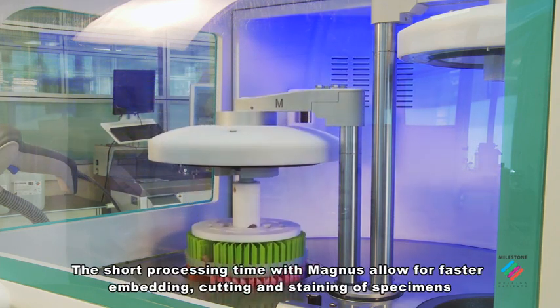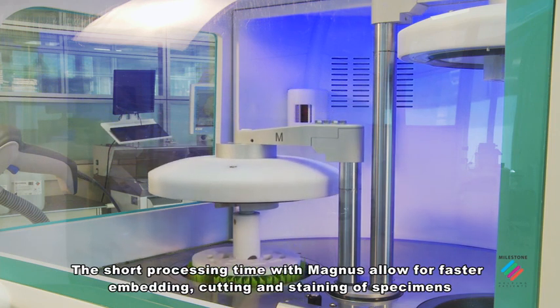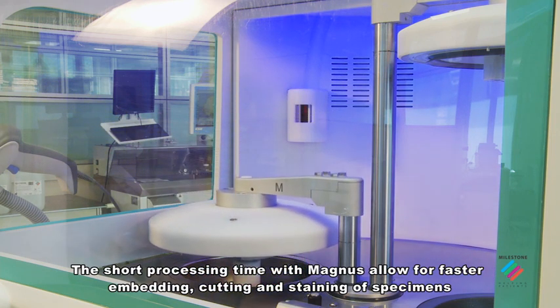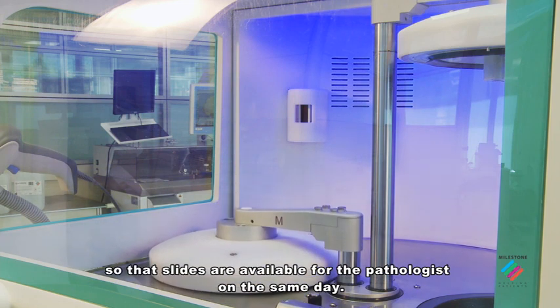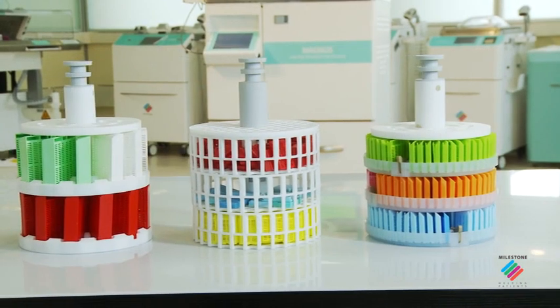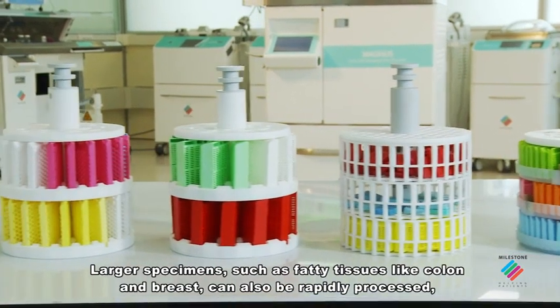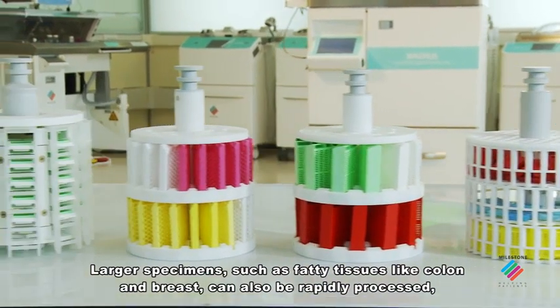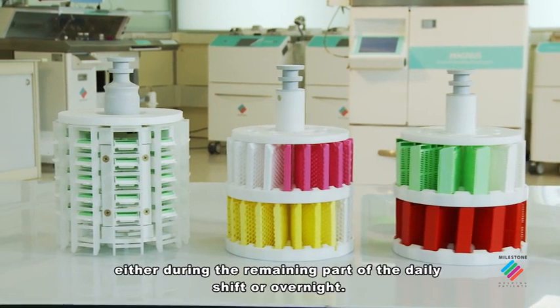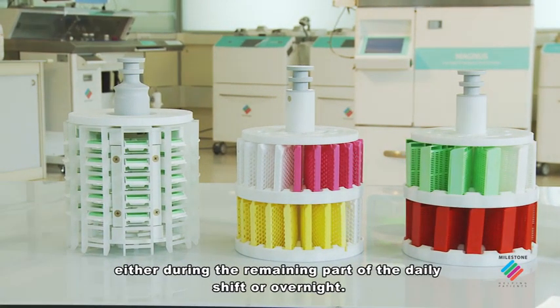The short processing time with Magnus allows for faster embedding, cutting and staining of specimens so that slides are available for the pathologist on the same day. Larger specimens such as fatty tissues like colon and breast can also be rapidly processed either during the remaining part of the daily shift or overnight.